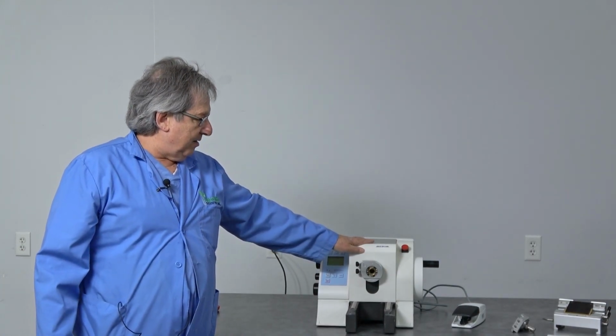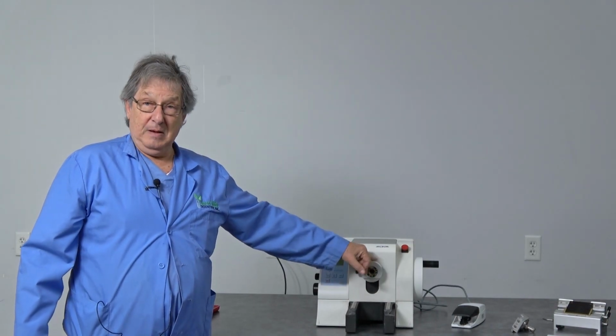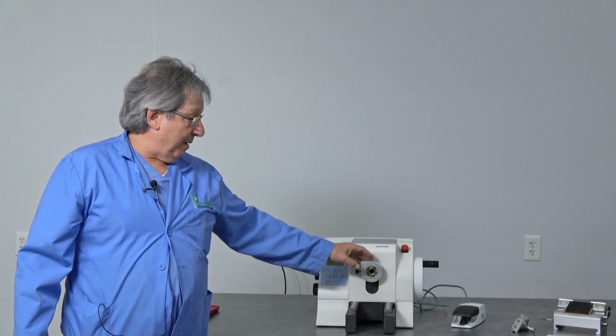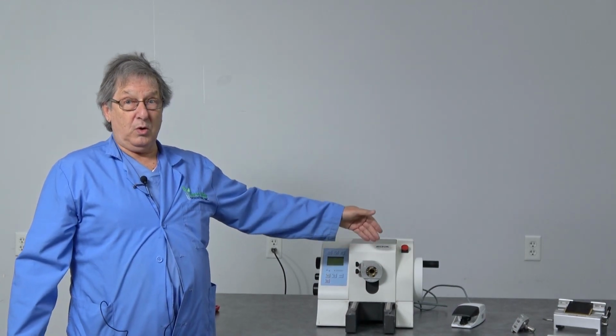Many of these models do have a common problem, and that is that after they sit for a while, the motor mechanism that advances and retracts the sample from the knife doesn't work or it seizes up.